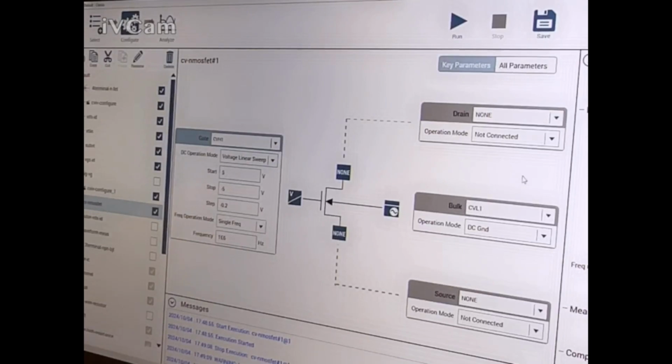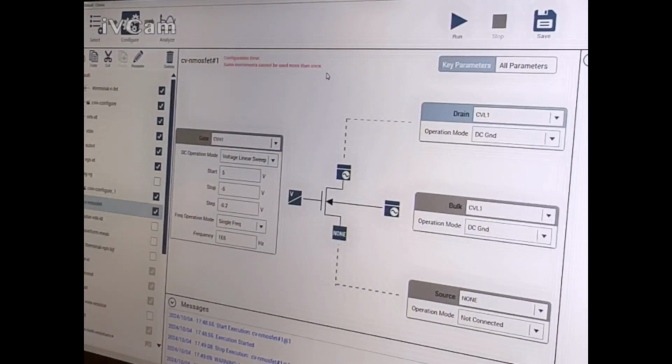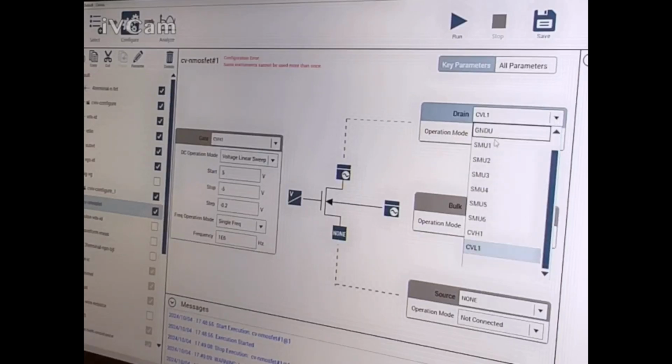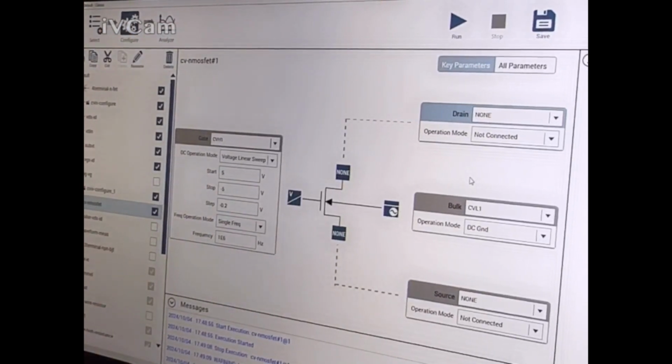I don't think you have to. I think you just leave those as none. I think that's the way it should work. I could try it, but I don't think it matters. CV low, you cannot use more than once. So you just leave that as none, since you got it done there. Sure. Why is it not working though? I got them connected correctly? I guess that's the first question.